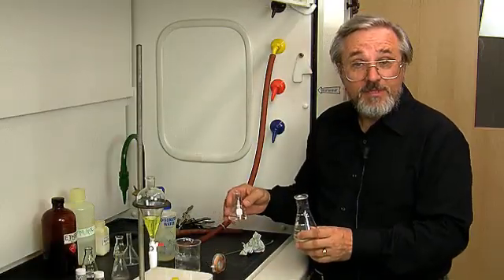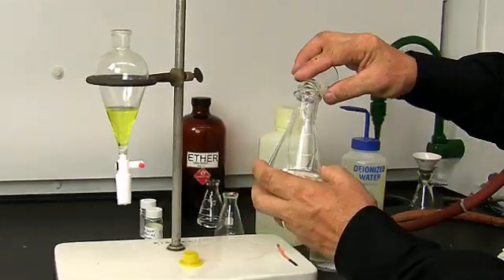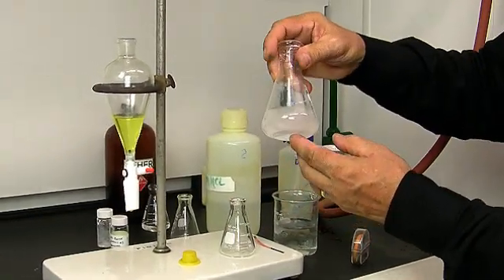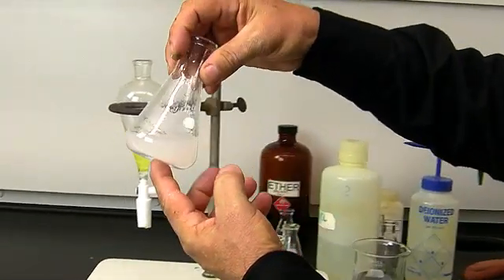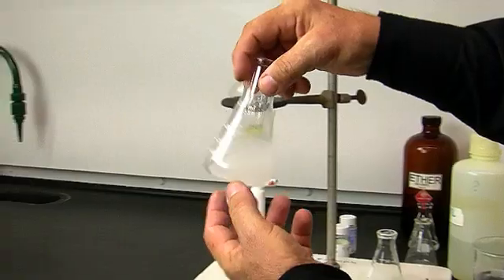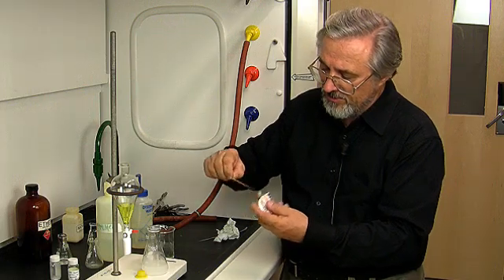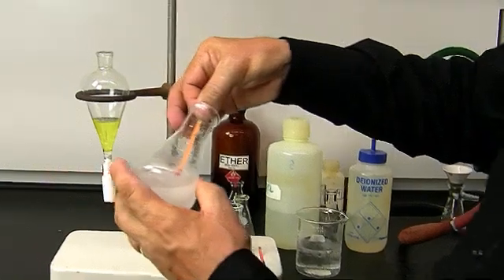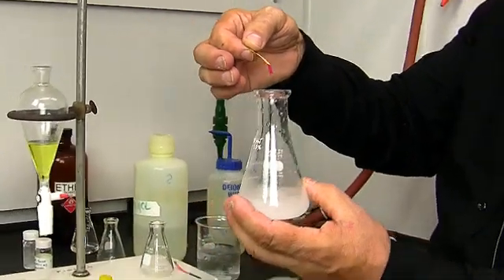Now we're going to add HCl. We're going to convert this back to an acidic solution. And watch. You can see that the benzoic acid is coming out of solution. See that? Now let's test to see if the medium is acidic. Let's put it in there. Red. And that means the pH is approximately 1, which is a guarantee of being acidic.